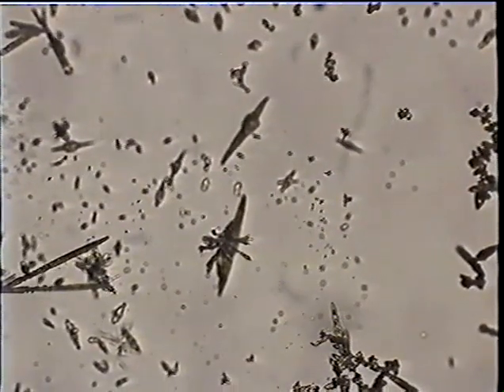But this is TNT crystallized from the melt under a cover slip. And that was the low temperature form. This is the high temperature crystal habit of TNT. It's growing just below the freezing point. This squiggly crystal front is very characteristic of TNT. Makes it easily recognizable at sight. Many compounds can be identified this way by looking at the characteristic crystals that form after you melt them and cool the slide so that they crystallize on cooling.